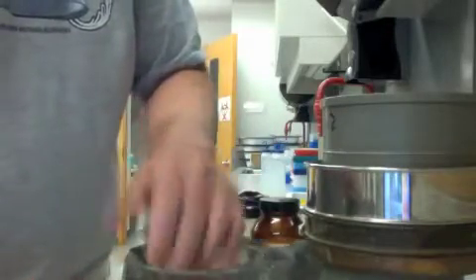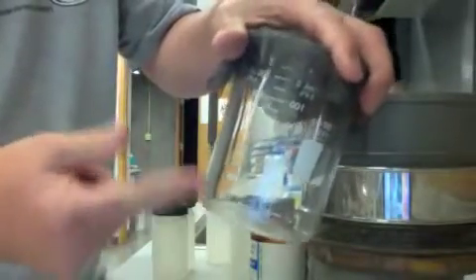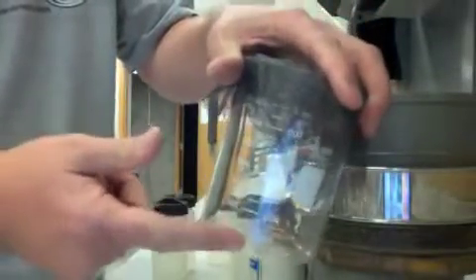You can basically put your sample in here, cover it up with your hand, and sort of shake it a little bit. And you'll end up having soil come down here that's sifted, and you'll have the material up here to get rid of. So that's one way to do it.